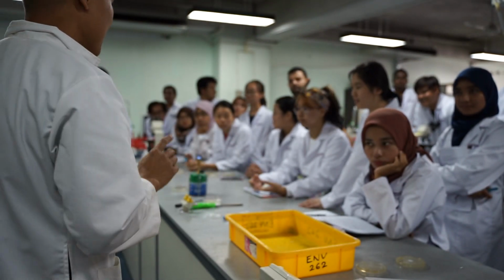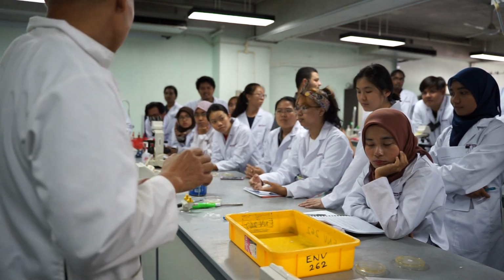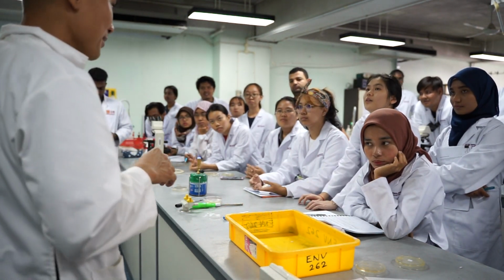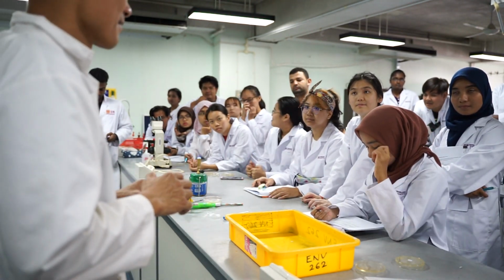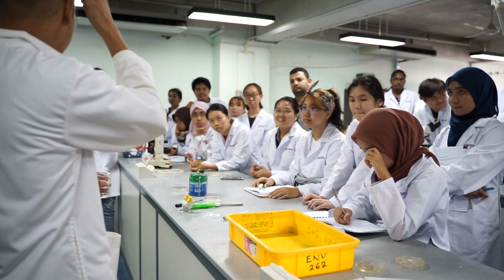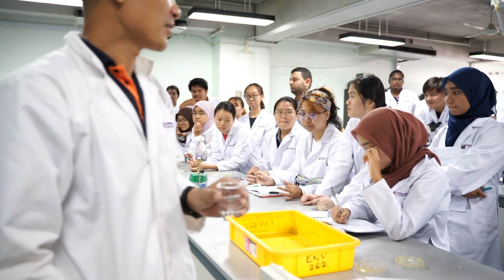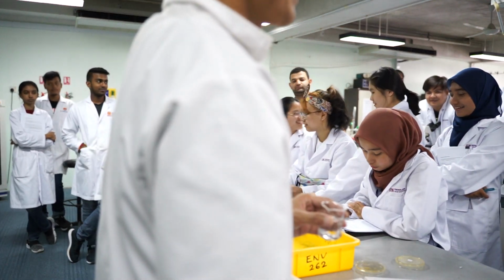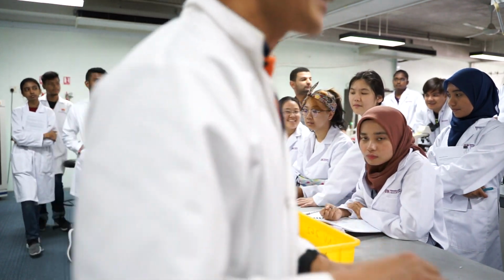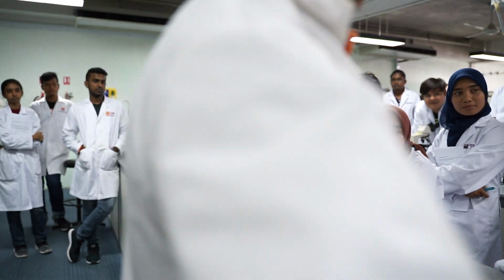Sorry, change the topic first. But I just want to show you how to do hockey stick. Last week it didn't work because our alcohol was not right. This time, okay. This is fine, change it later. This is not part of it. I just want to show what I remember because last week our hockey stick doesn't work. Good that you all at the back came. Luckily you all came. Is there some? Okay. There is alcohol too? Okay. Is this new alcohol? I replaced it with the big one. Replaced, yes, not the small one.